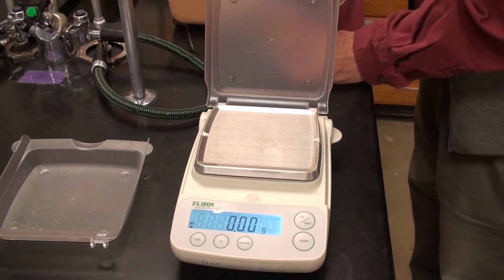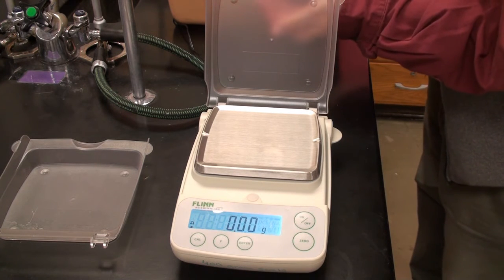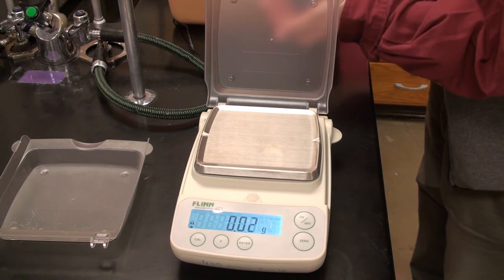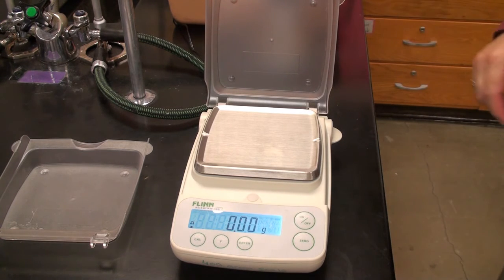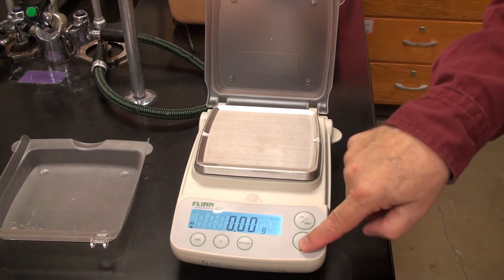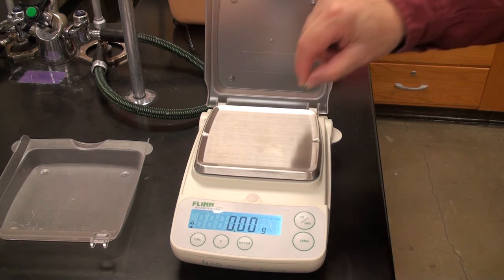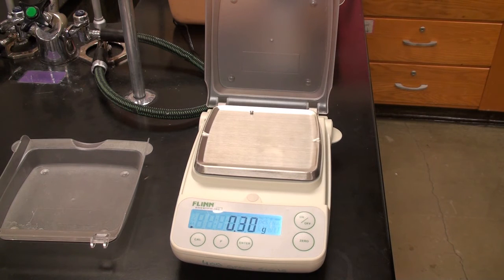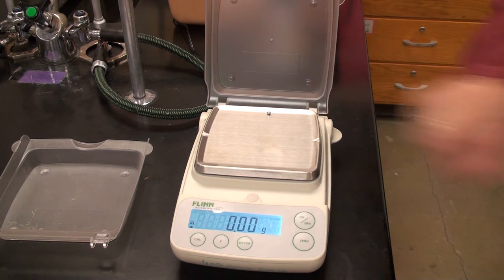Okay, we're continuing on here with our seventh and last type of bead. So these are just BBs. Once again, I always zero the balance before I go. For the first one over here, I want to make sure it's not moving. I make sure when I talk, I'm not breathing on it. Okay, here's the first one. That looks stable. Zero it out.